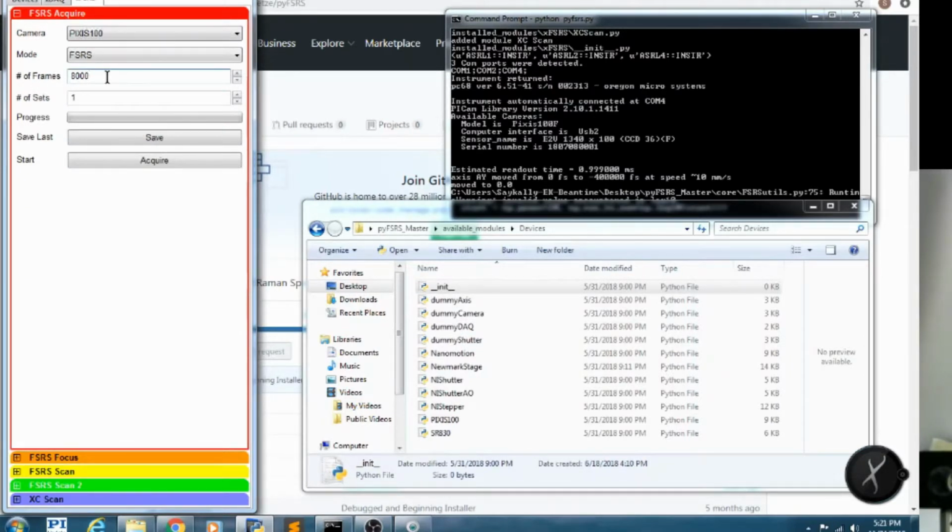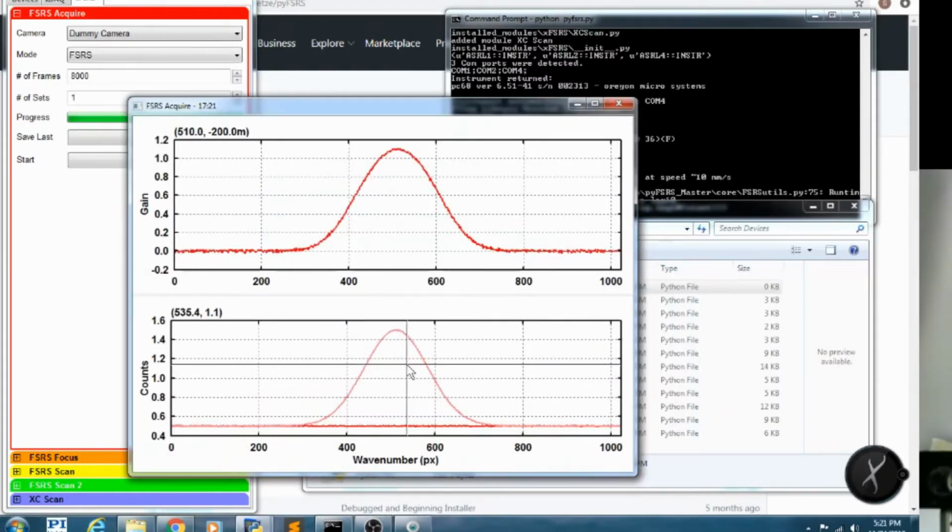FSRS Acquire is similar, except we can average multiple sets and then save the output of each set to a text file. Here I'm running 800 shots, or 8,000 shots, so this should average for 8 seconds. And here's the result. We have much lower noise in our signal because we've averaged for longer.